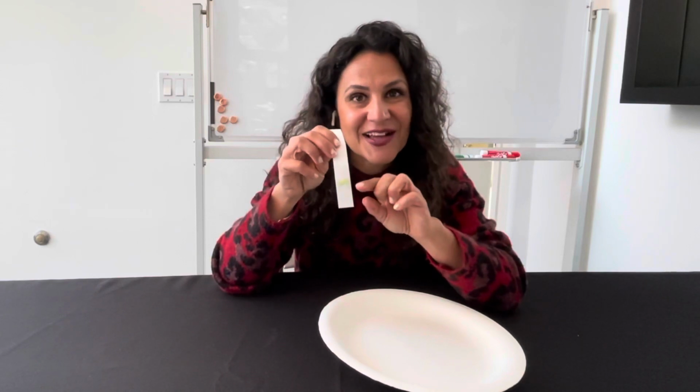Now there's other colors that are produced later on in the cycle, the reds and the browns. We don't see those because those are not being produced yet. But this yellow is definitely here along with the green. Chlorophyll chromatography, separating out the colors with the colors inside of the chlorophyll.